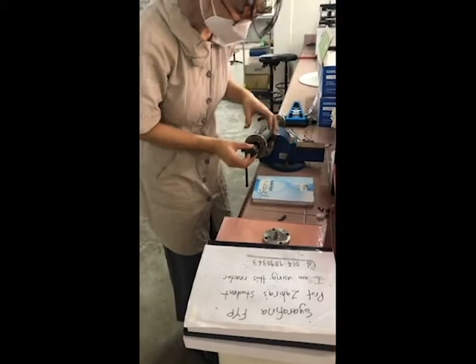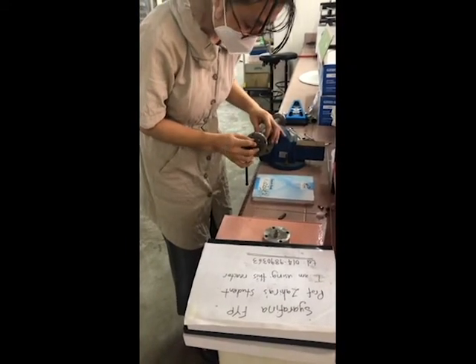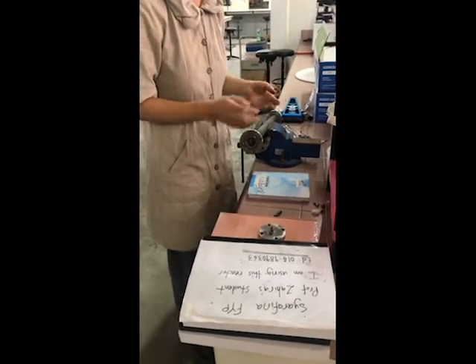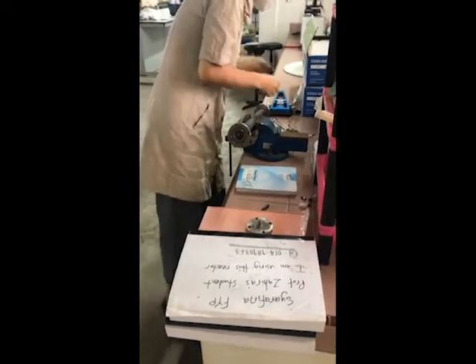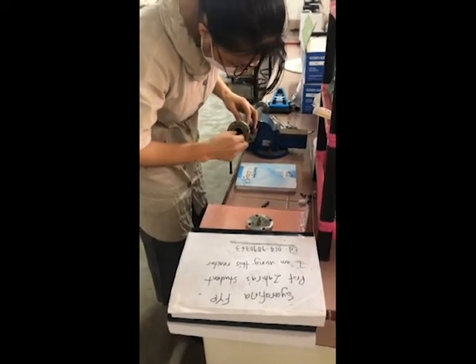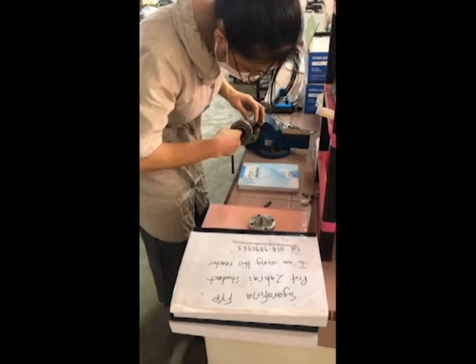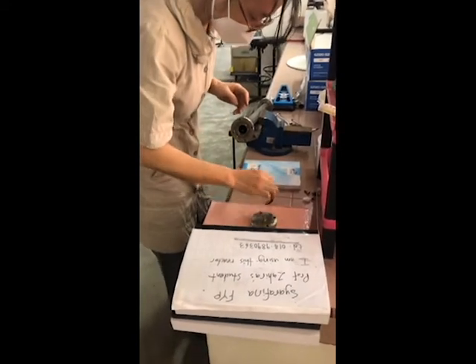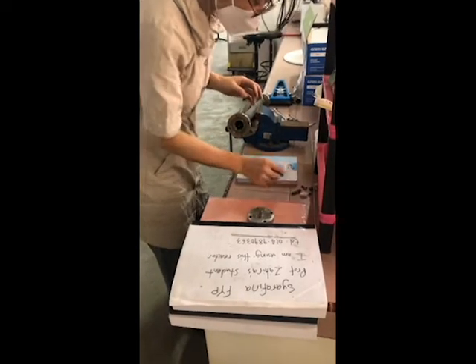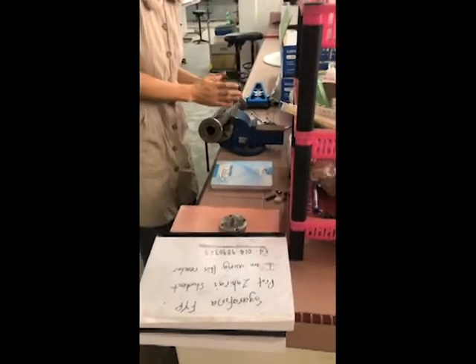Your catalyst is in here. So your gas distributor will push your catalyst into the center. Then you push in the rest of the holder. Then it's okay. Oh, I forgot to install this one, so it becomes short. So don't forget to install this one, that one in between, on the catalyst pipe.